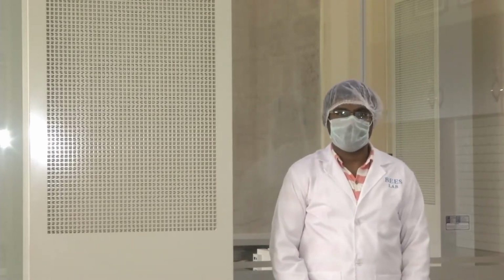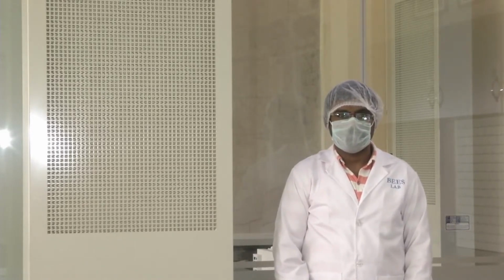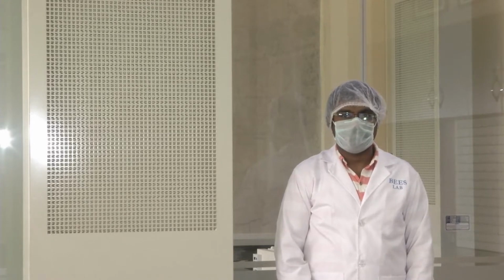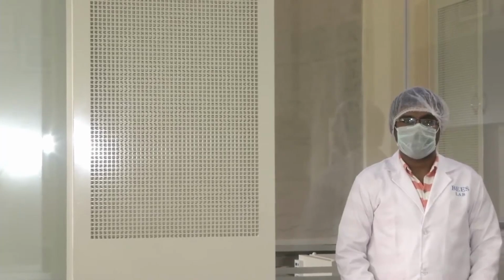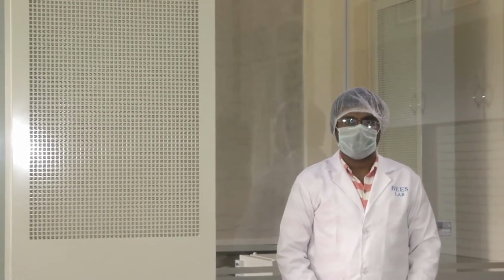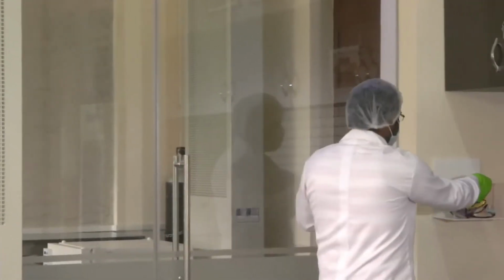Now you might think, okay, the HEPA filter is there, the filter will clear everything, even if there are a larger number of particles inside, the filter will clean it up. No, the filter has its own limitations. So we have seen the two components of the HEPA filter. Now that Sitaram is outside the biological section, he is not doing active work, so he will keep the goggles back into this goggle tray.